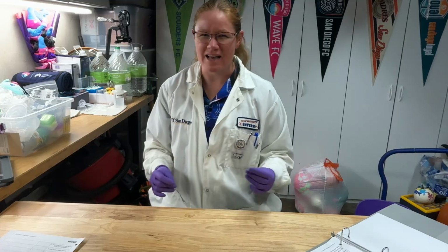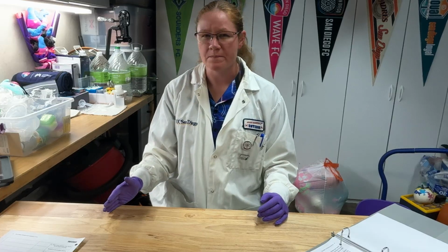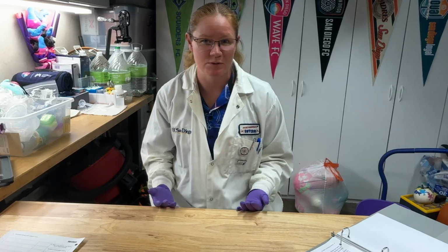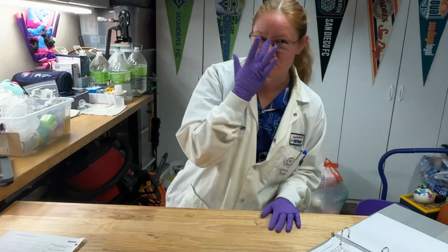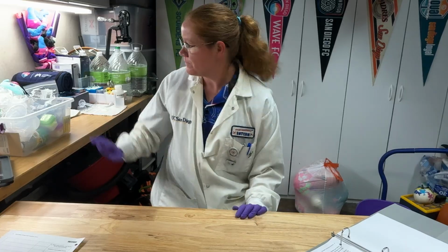Today we're going to be looking at a single replacement reaction and then doing some stoichiometric calculations to figure out exactly what was going on with our product. We're going to use the stoichiometry to figure out how much product we could have formed, and then when we look at the end of our reaction, we'll figure out how much product we actually formed, and then we can calculate a percent yield.